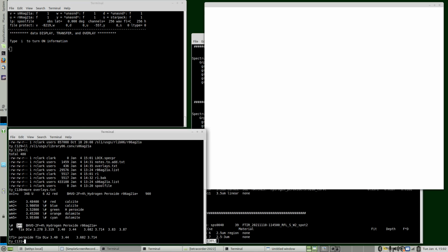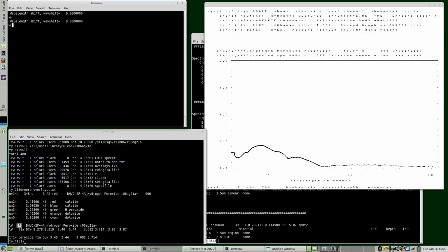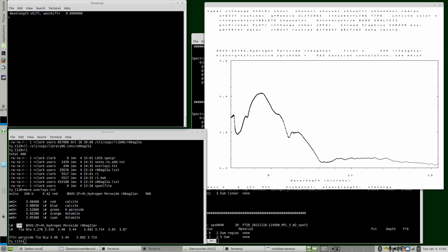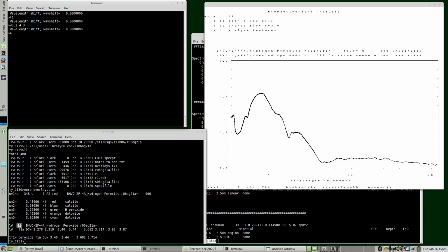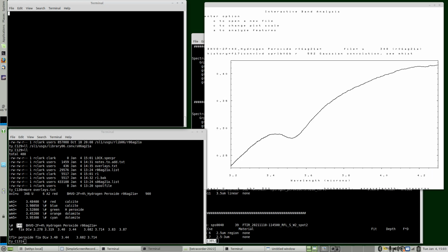The hydrogen peroxide spectrum is in the research library at capital U 6. We need to change to wavelengths, auto scale. I'm going to change to line type 1. Then since we're looking at this feature over here, let's only look at wavelength range 3.2 to 4.3. I didn't get into the change scale routine. W 3.2 to 4.3 auto scale. Okay, so there's the feature.